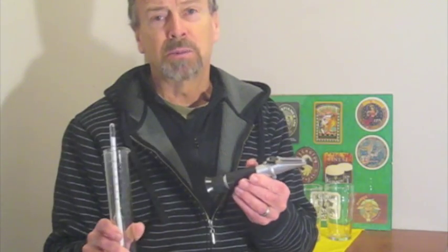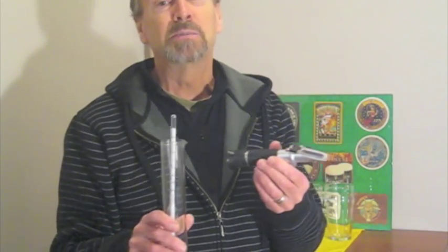This is interesting to me because during my normal brewing day, I've noticed an effect where I'll measure one particular sample, come back just a few minutes later, and all of a sudden, the refractometer has changed by as much as one or two brix. That's a huge difference when trying to measure your gravities.